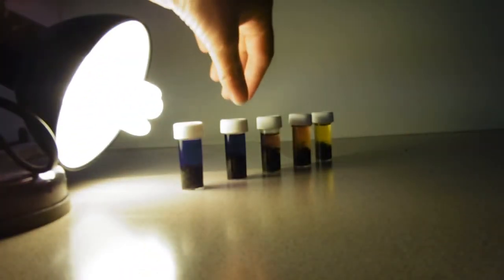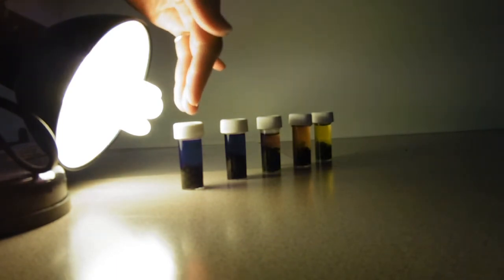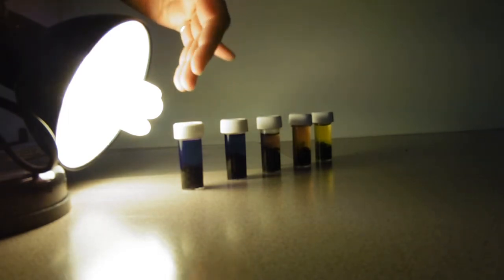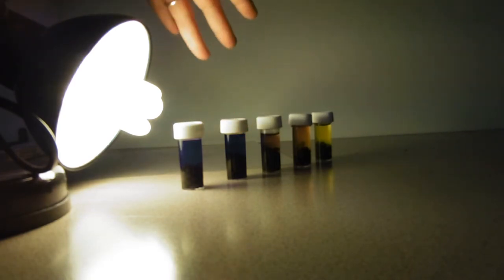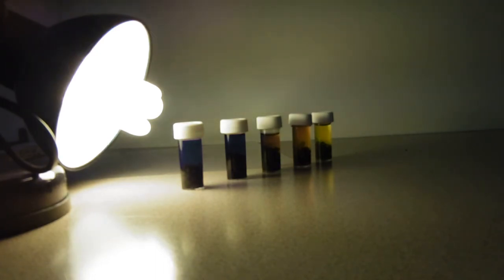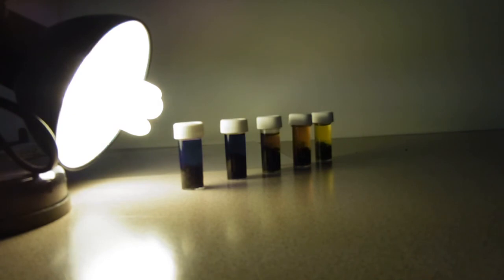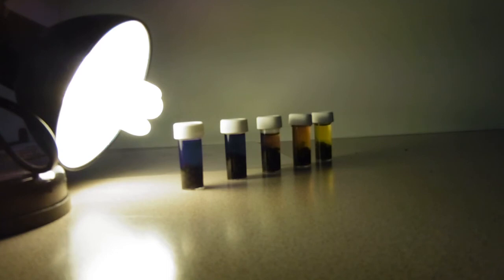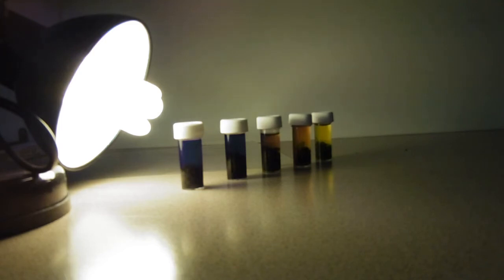Actually, what we're expecting is a sort of gradation. We'd expect this one to be photosynthesising the best, and then the next one still photosynthesising quite well but not quite as well. To make it more quantitative, we would have to put that solution into a colourimeter. What we're going to measure is absorbance, which is a really good way of using a colourimeter to tell the difference between different shades. We did this with the beetroot juice, for example.